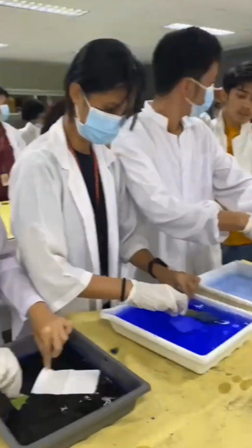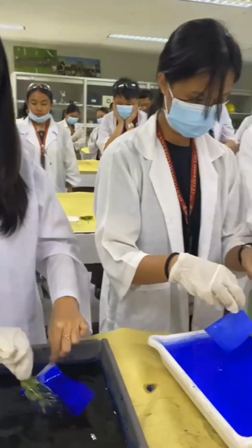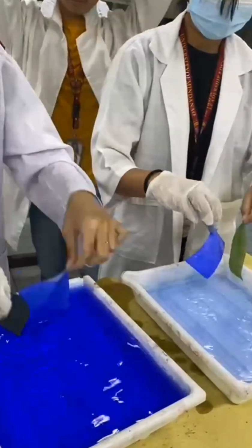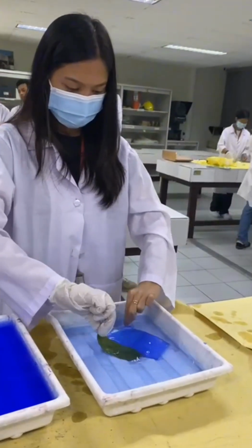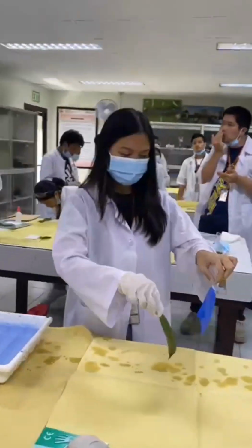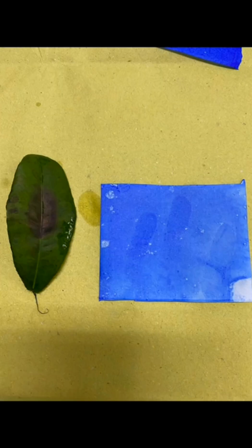The developed fingerprints begin to emerge as a vivid blue pattern, revealing rich details with excellent contrast against the background. The dye's interaction with the fingerprint residue resulted in a high-quality print, characterized by well-defined fingerprint ridge characteristics. Overall, the Victoria Blue method proves to be an effective and straightforward technique for developing latent fingerprints, making it an essential asset in forensic science for fingerprint analysis.